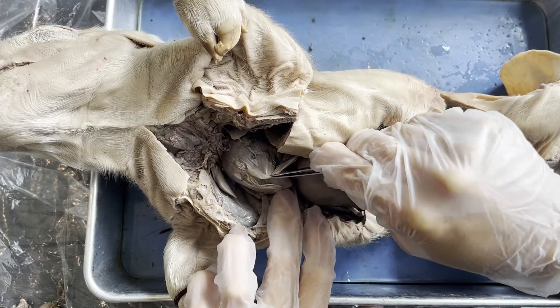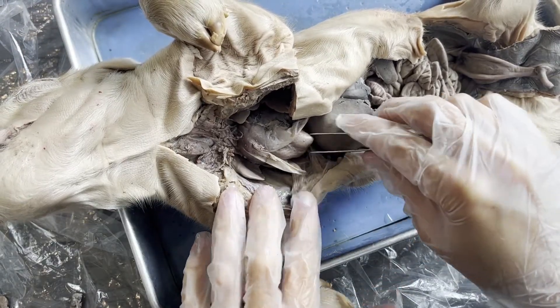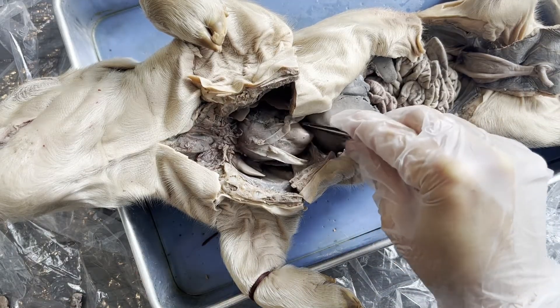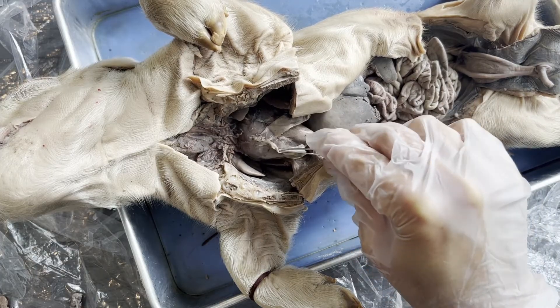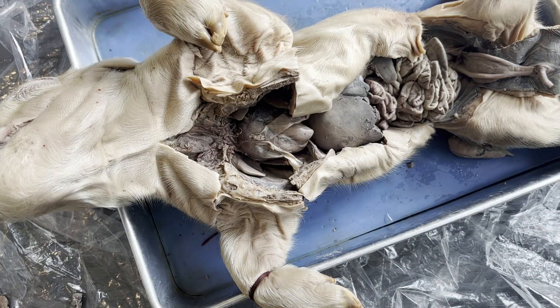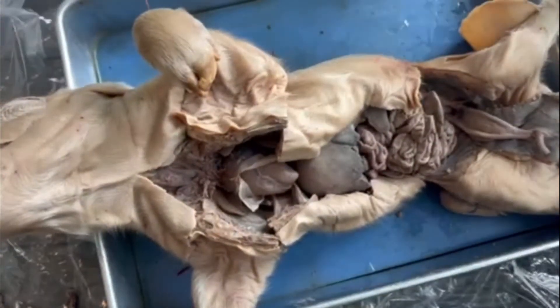The pericardium is a sac of tissue that holds the heart in place. It's also filled with fluid so that every time our heart contracts and relaxes and beats, there's not going to be any friction from the heart against the lungs or anything around it — because there's almost like windshield wiper fluid inside the pericardium that reduces any friction of the heart contracting and relaxing. Now I'm going to remove the pericardium so we can see some of the deeper structures inside the heart.